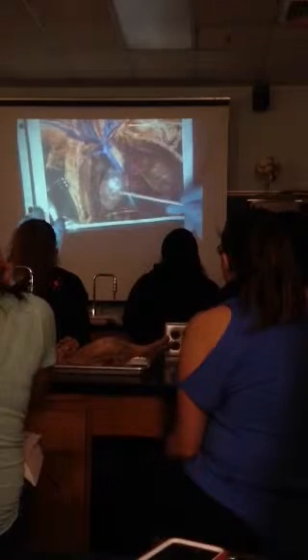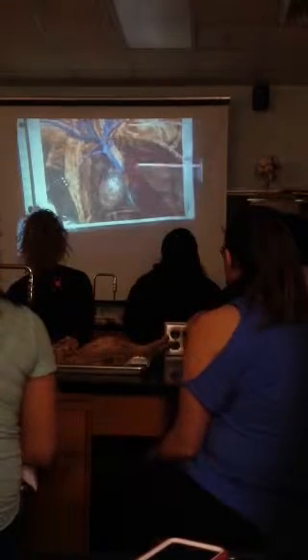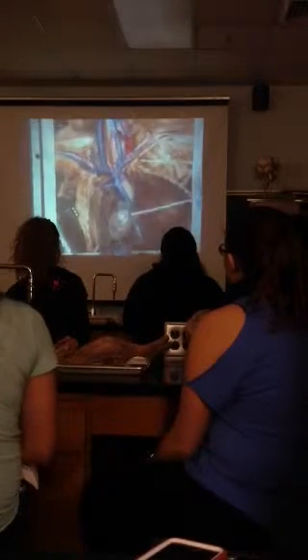Okay, so you can see heart here, you can see some lungs going out that way. And honestly, we don't really get a good view of ascending aorta coming up at all because the superior cava is blocking it. But you do start to see this pulling over to the side down the front part of the thorax region. Anyone know what that could be?